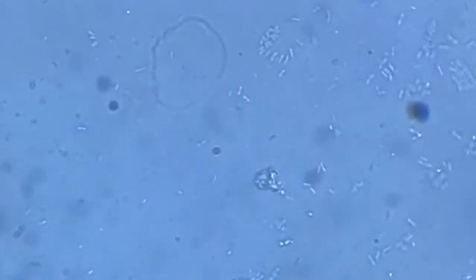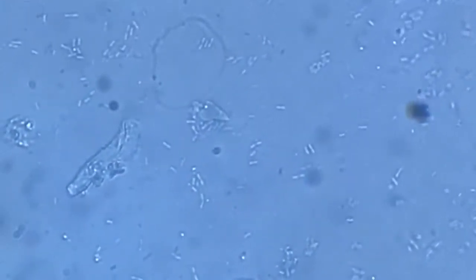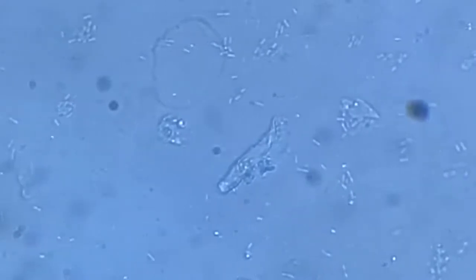Bacteria, bacteria, bacteria. What is this?